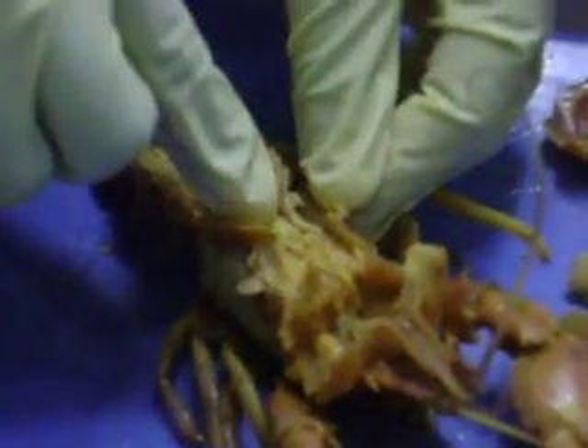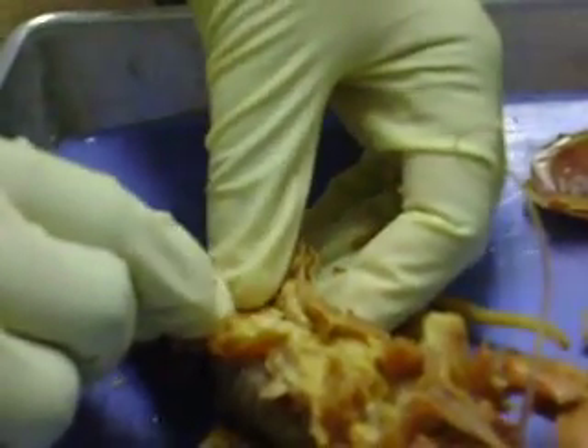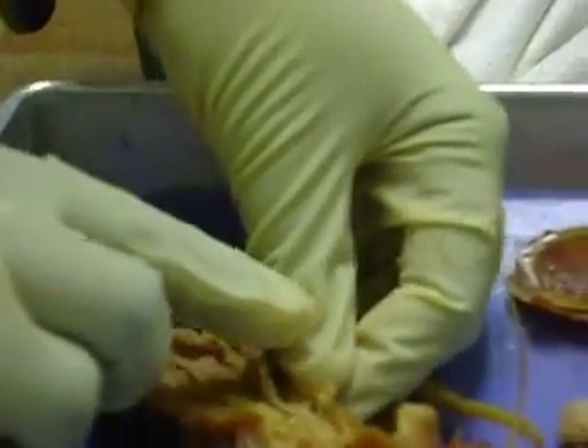Did we point out the heart? Did we point out the heart before? Yeah, that thing right there — we totally referenced that yesterday with the cow thing and the tornadoes. Some tornadoes come with something, some don't — some with cows, some not.